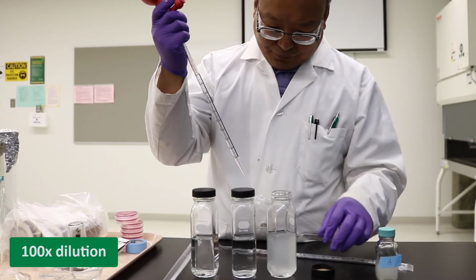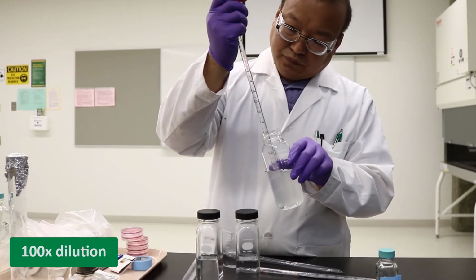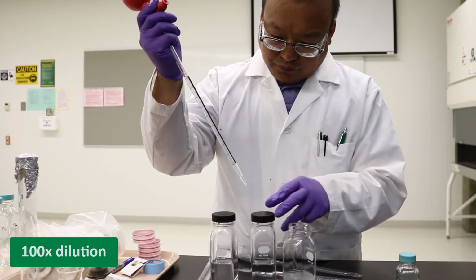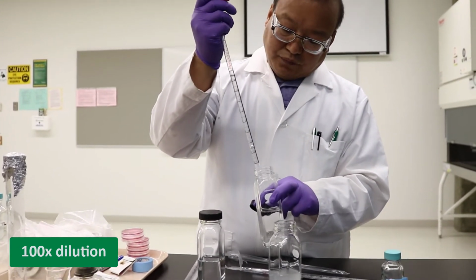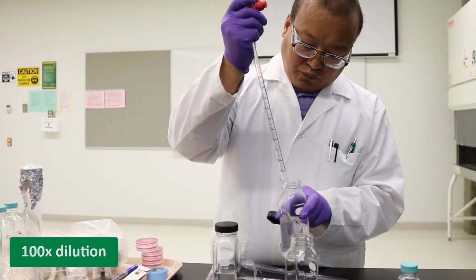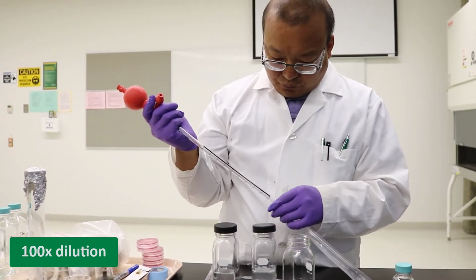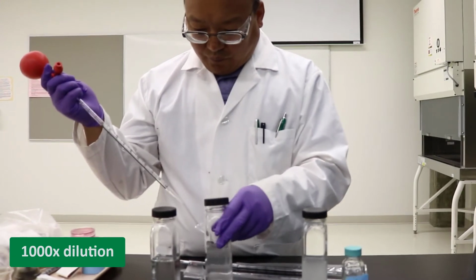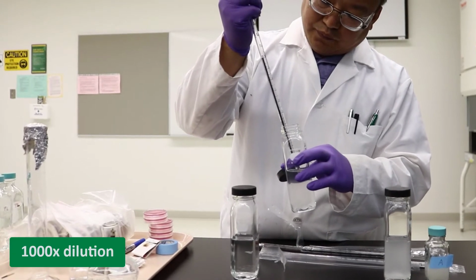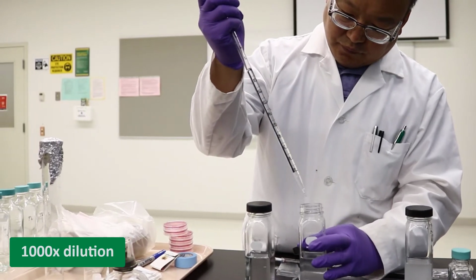Now, take a 10 ml sample from the 10 times dilution bottle and transfer it to a second bottle with 90 ml dilution solution to complete the second 10 times dilution. This one is 100 times dilution solution. Similarly, we can make 1000 times dilution solution and even more dilutions. In today's work, we only need 3 dilutions up to 1000 times.